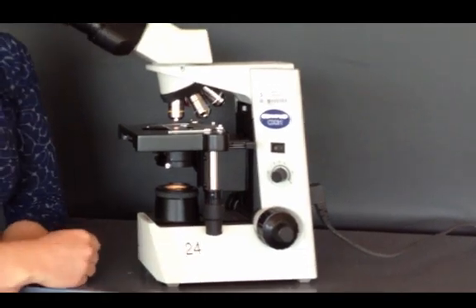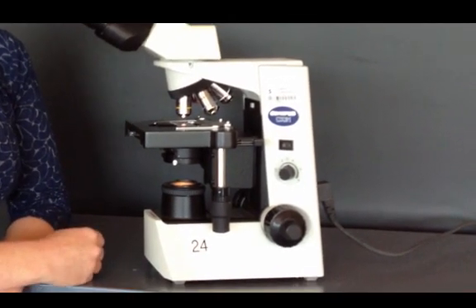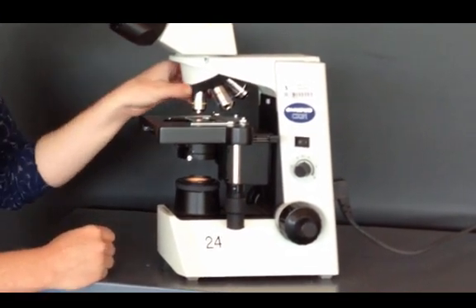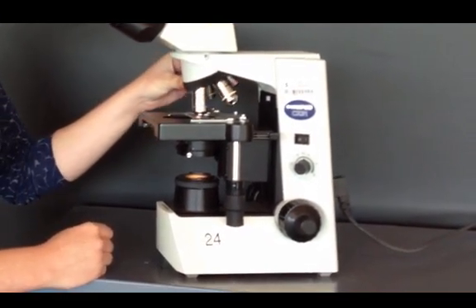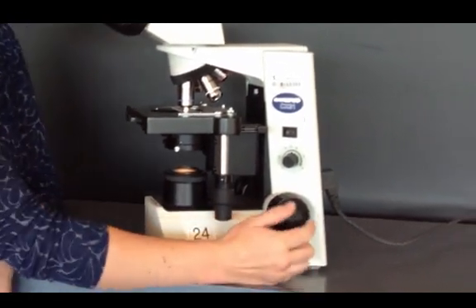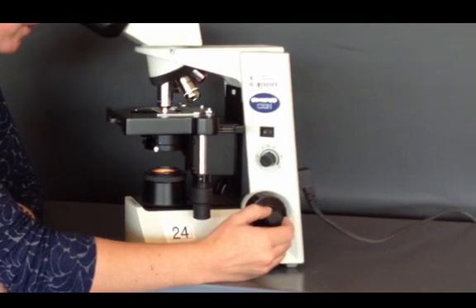When you're ready to increase magnification again, make sure the specimen is in the middle and then rotate up to the next magnification using only the fine focus to bring your specimen into focus.